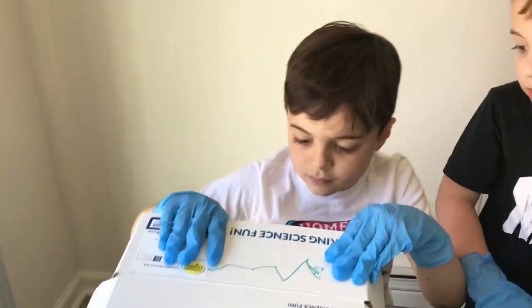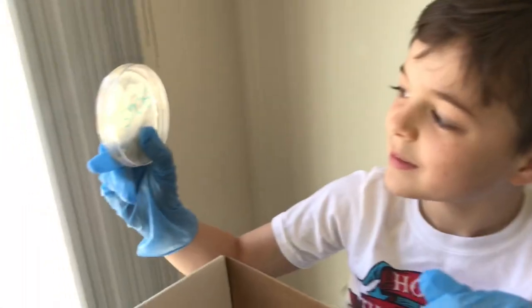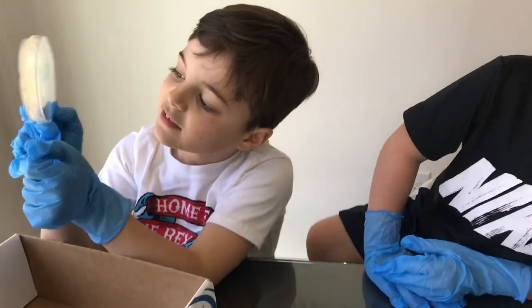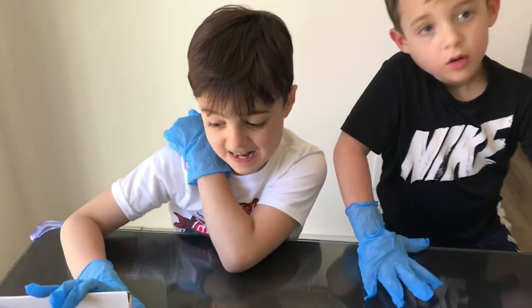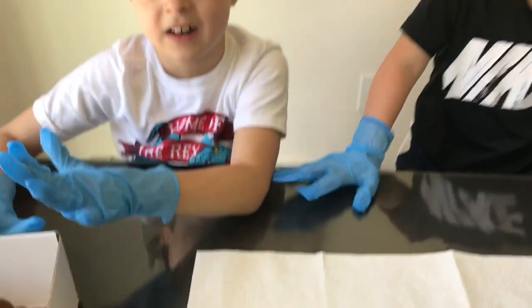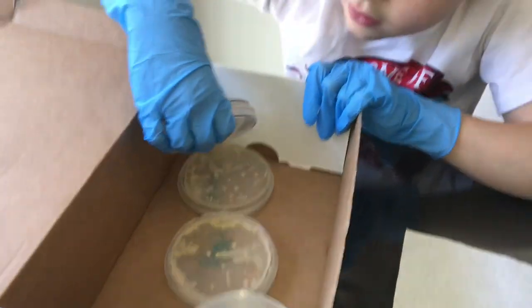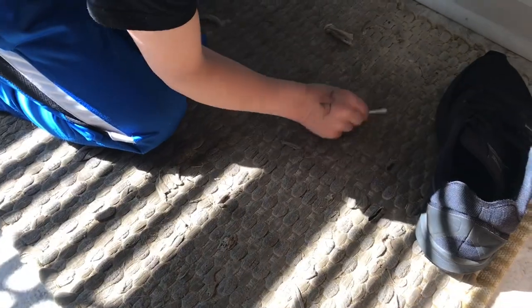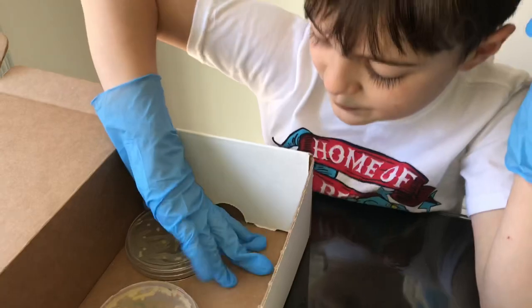What's the first one you have? Shoe. Oh my goodness — look at all that bacteria! That does look like a lot of bacteria. That's why it's important to take your shoes off — you don't want to walk around the house with your shoes on. Let's do the next one. The mat? Oh, I see a little yellow one. Okay, moving on to the third one.